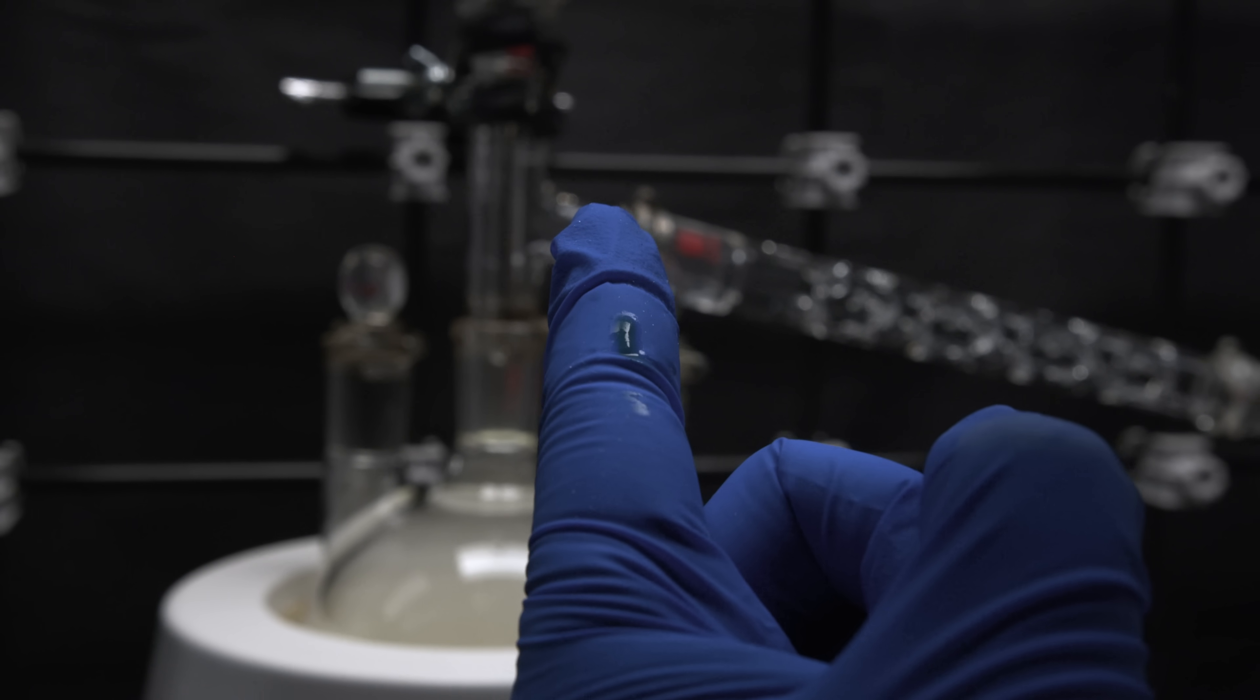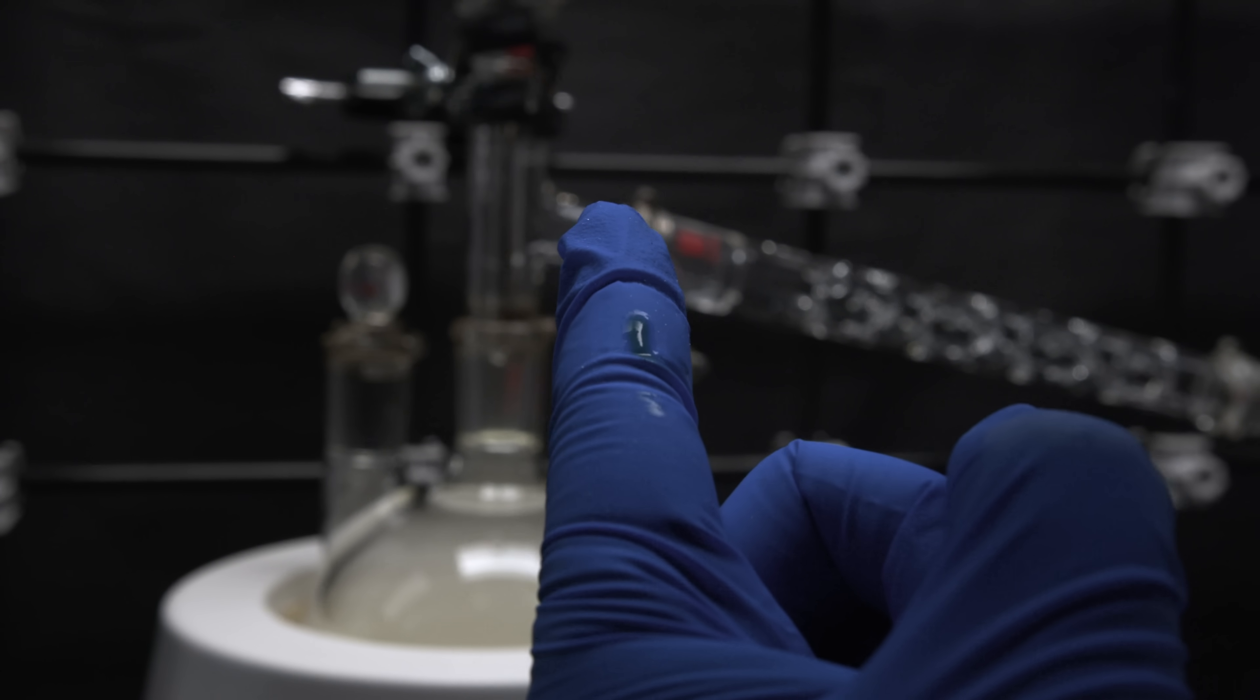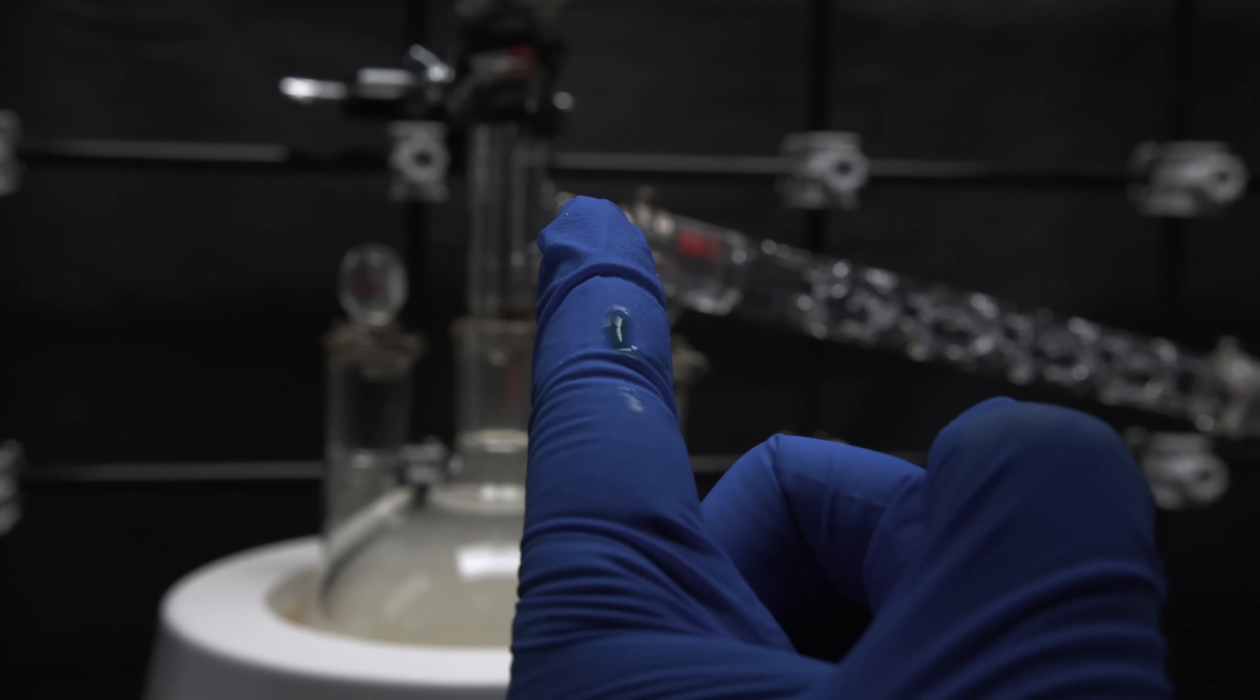Also, if you spill any acid on your gloves during refilling or at any point during the experiment, remember to swap it out as sulfuric acid can slowly penetrate your gloves.